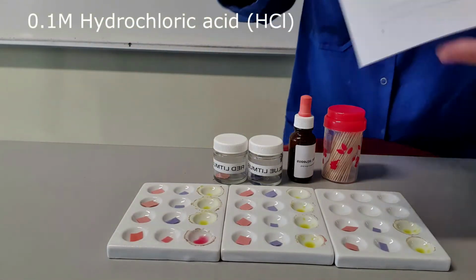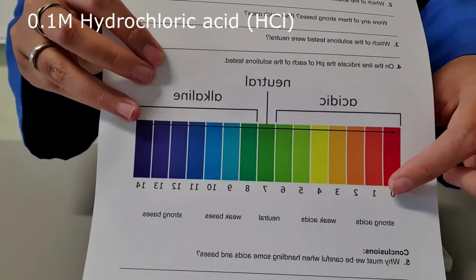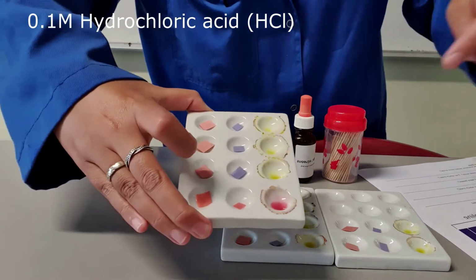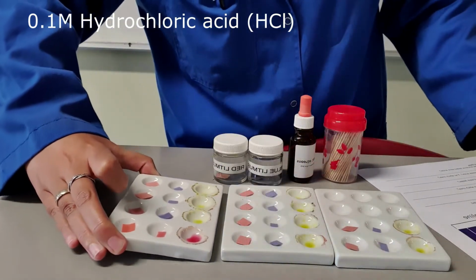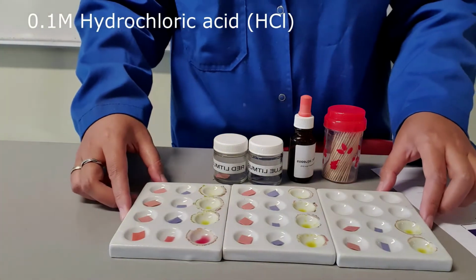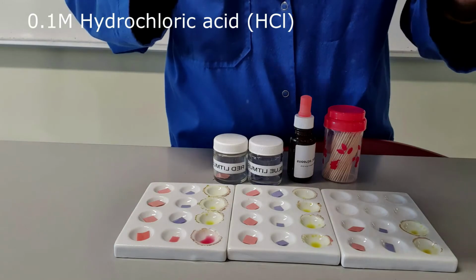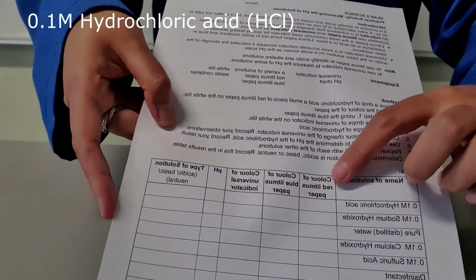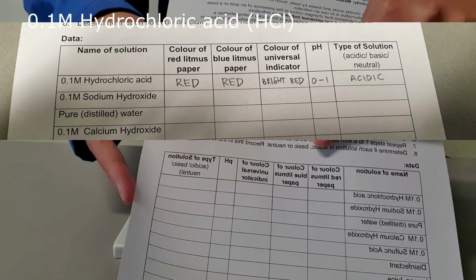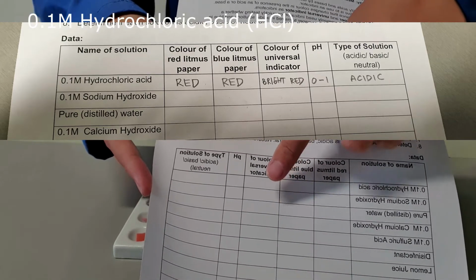Okay, this one, and you need to select which pH value this acid has. Okay, and basically that's what you need to do for the rest of the substances. First, under color of red litmus paper, you would write red. Color of blue litmus paper, red. Color of universal indicator, red.